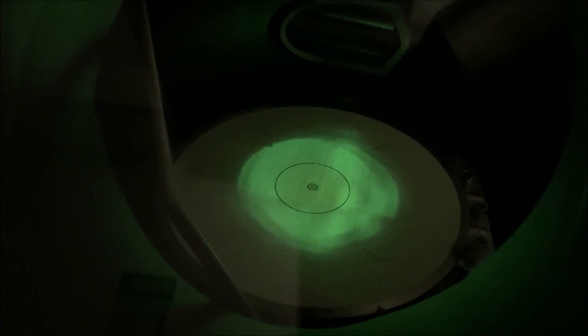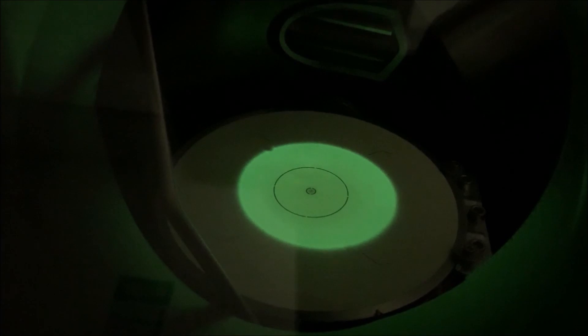Now after you align the zone axis, what's going to likely be the case is that you're not going to be at eucentric height. So you need to return to image mode and re-establish eucentric height.